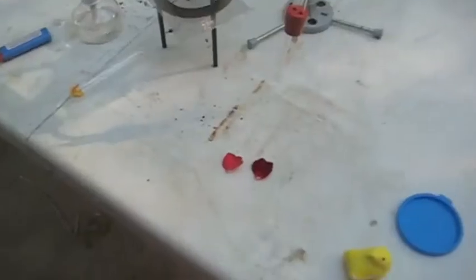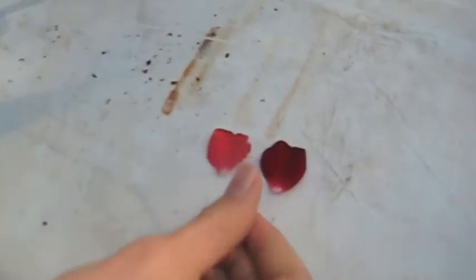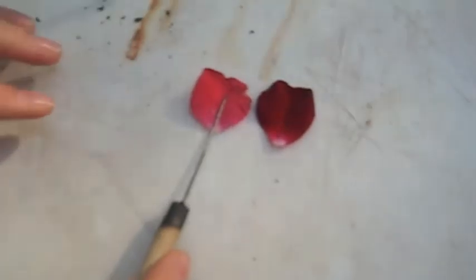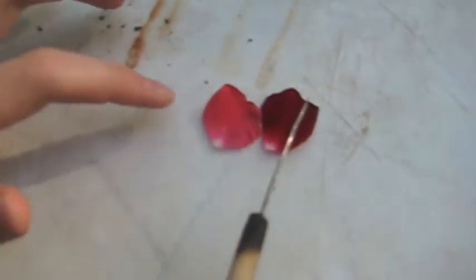Now in here the rose petal seems lighter so we have a bleaching effect. If you compare it with a fresh rose petal you can see the difference. There's a large difference between the rose petals that have been bleached by sulfur dioxide and the regular rose petal.